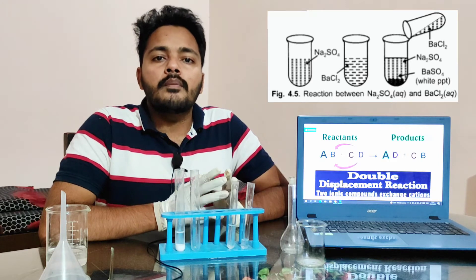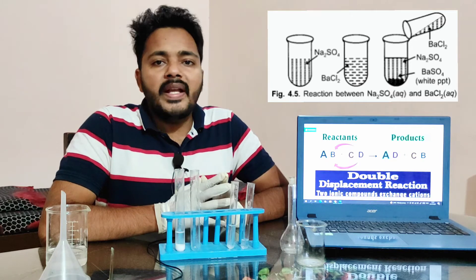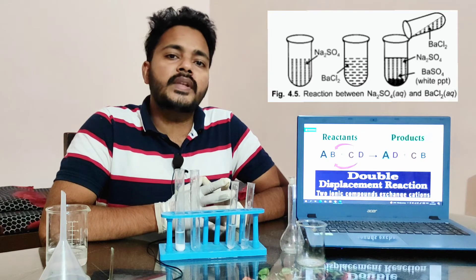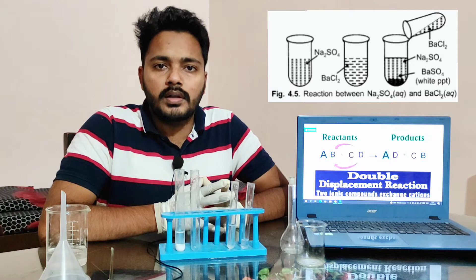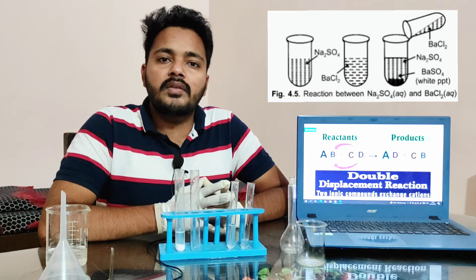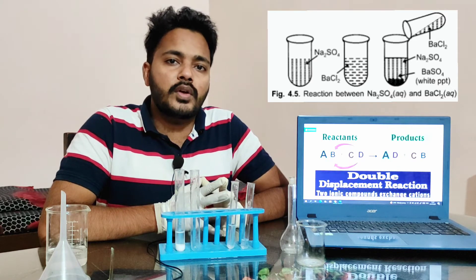When you combine barium chloride solution and sodium sulfate solution together, barium sulfate and sodium chloride are the main products. Out of these two products, sodium chloride is clearly dissolved in water, but you will get a white precipitation of barium sulfate which will settle at the bottom of the boiling tube after some interval of time.